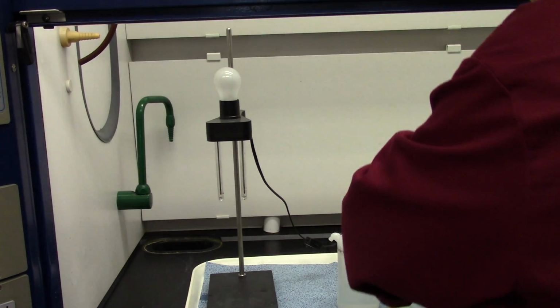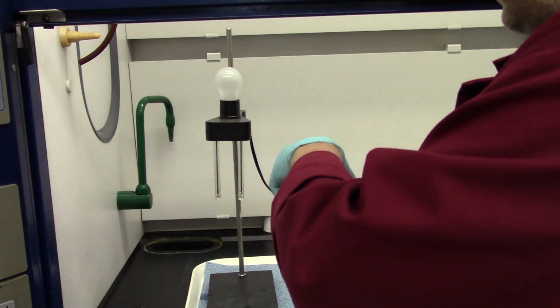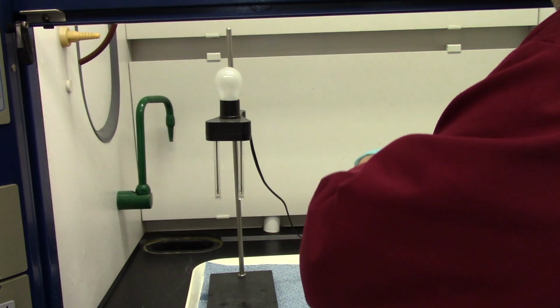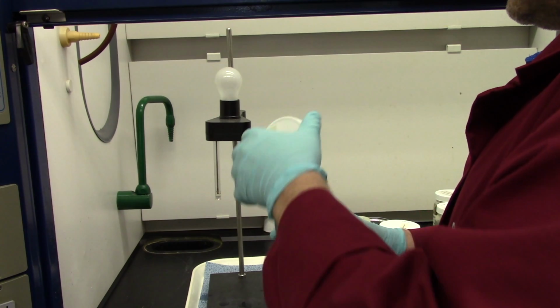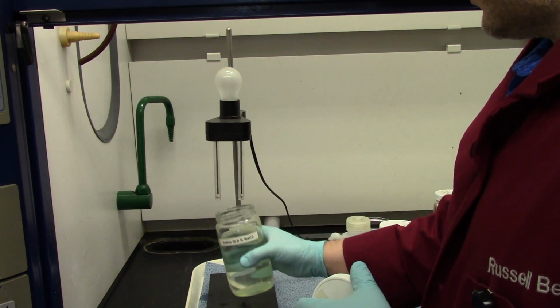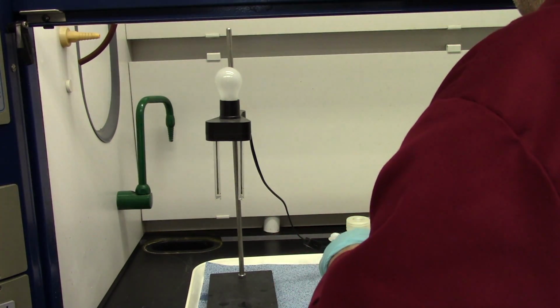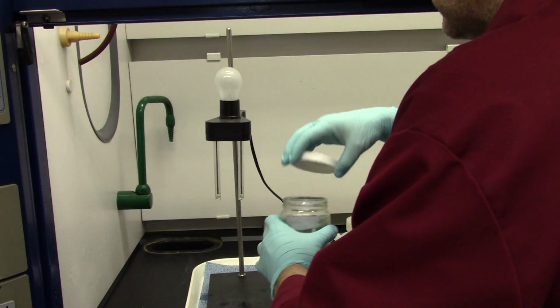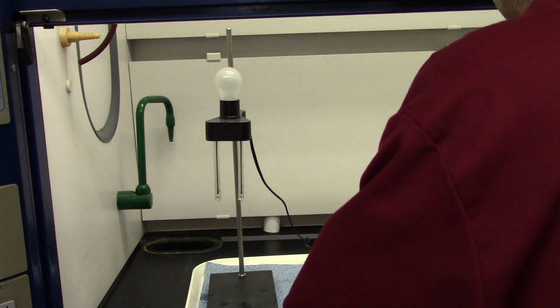Here, let me give it a quick rinse with the water here. There we go. Try again. Okay, here we go. Here we have sodium chloride, saline solution. There you go. You can see the lamp lit up pretty good because we've already determined that sodium chloride is a strong electrolyte. And again, saline solution is sodium chloride. It's a certain percentage of sodium chloride, about 0.9%. It's known as saline solution.